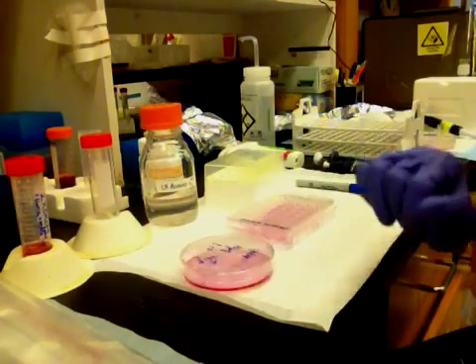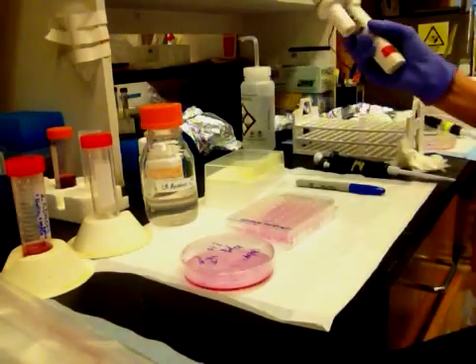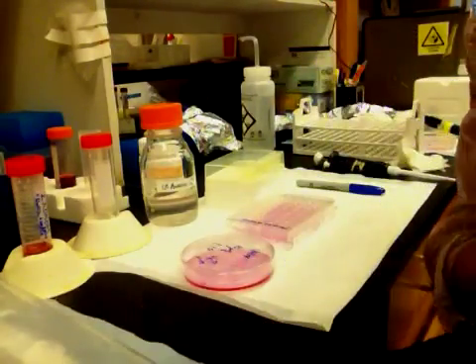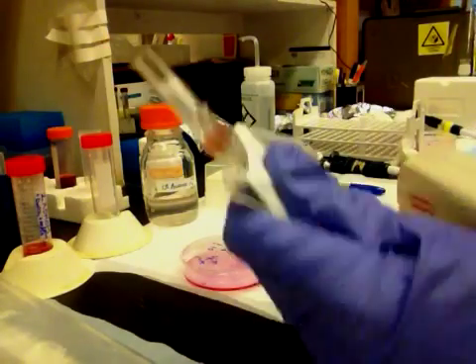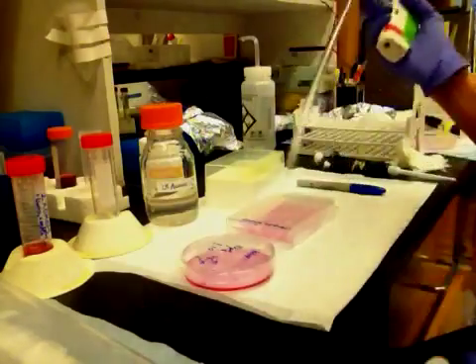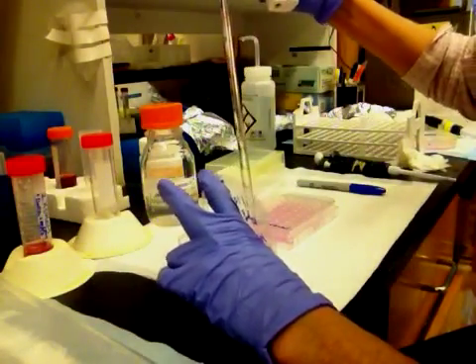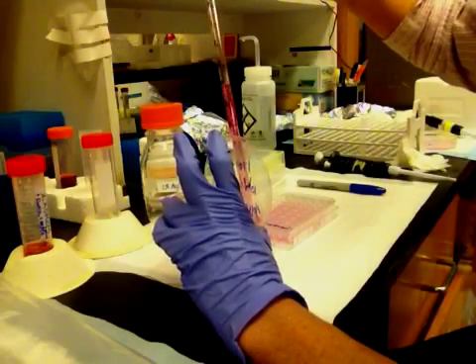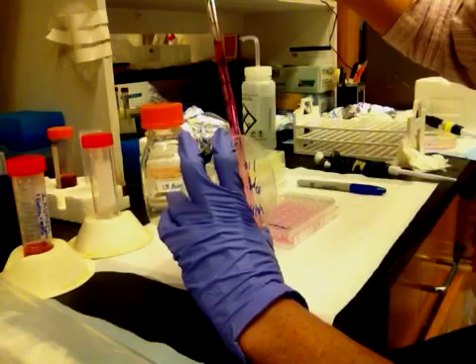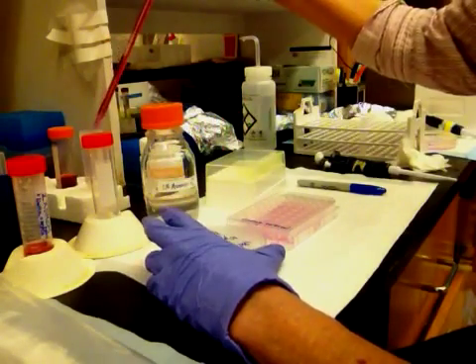The first thing is to get rid of the medium on top of the clones. I usually aspirate, but because I'm working on the bench — of course you will be working in the hood where everything is sterile. We have to remove all the medium from the plate. Remember to take it all off or the agarose won't stick.